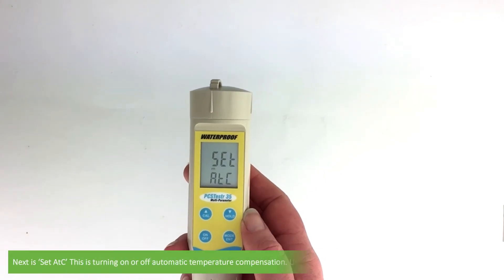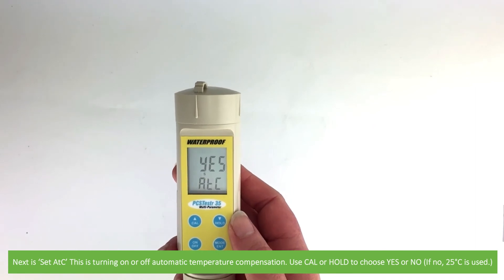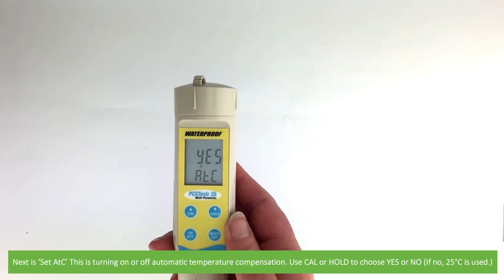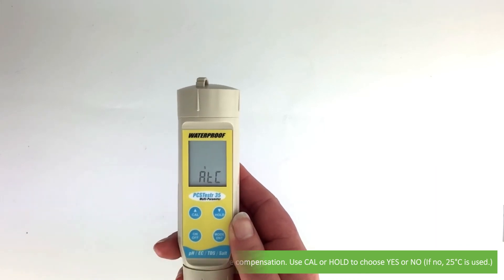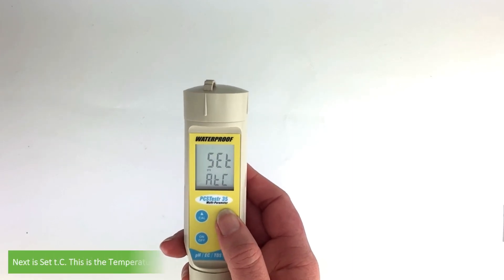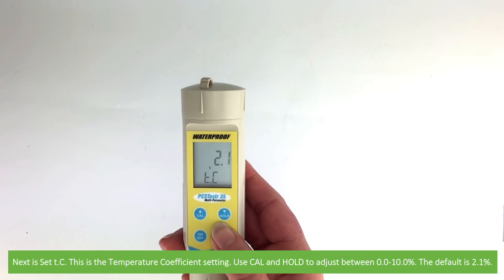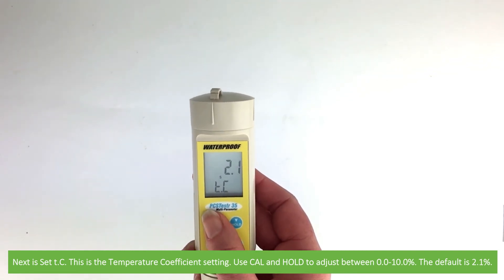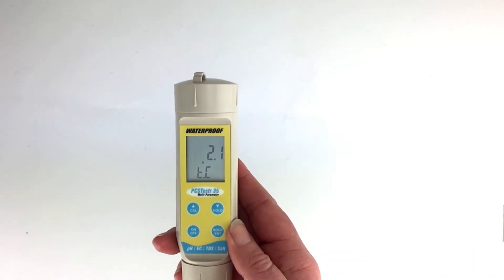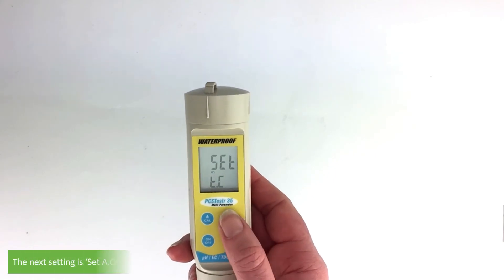Next is set ATC, which is turning on or off automatic temperature compensation. Use cal or hold to choose between yes or no. If no, 25 degrees Celsius is used. Next is set TC, the temperature coefficient setting. Use cal and hold to adjust between 0.0 to 10%, and the default is 2.1%.